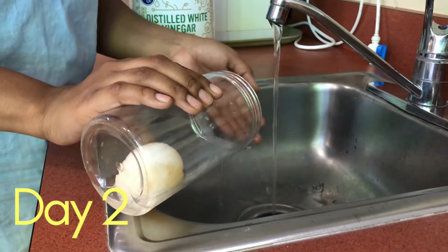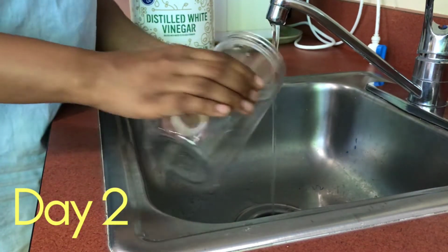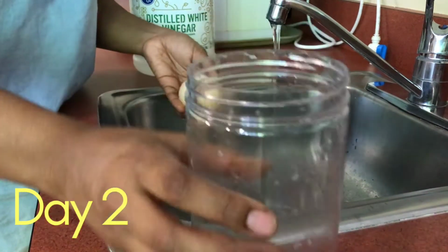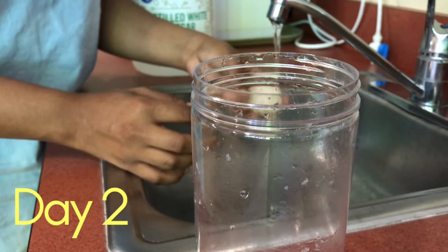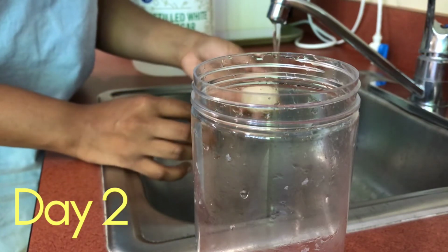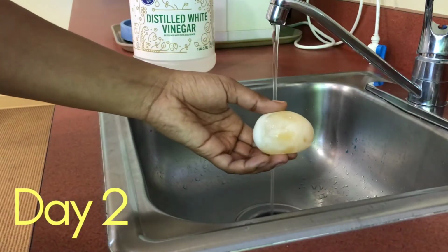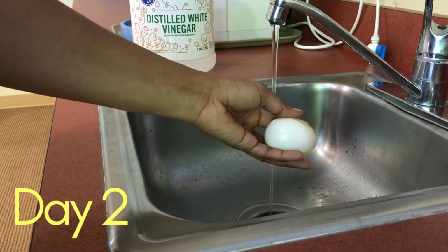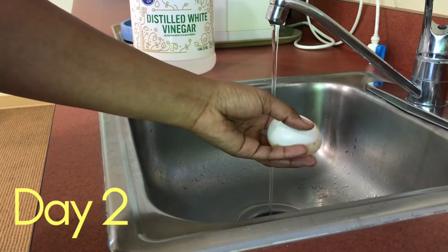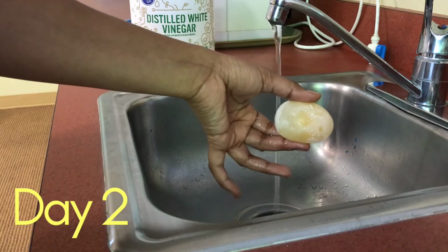I'm going to pour out the old vinegar solution and grab our naked egg, rinse everything out and rinse the egg off. I'm cleaning off the excess particles that we saw in the solution in the last slide, just so that we can see the egg really clearly. On one side, you see that it's translucent or clear, and then on the opposite side, there's still some type of hard white shell on the osmosis egg, okay?